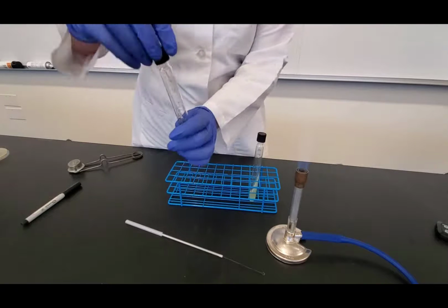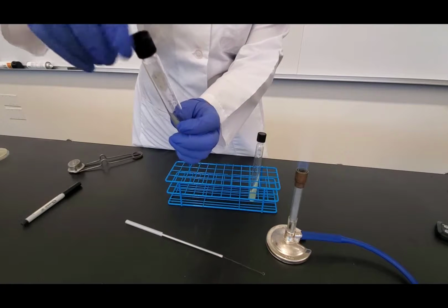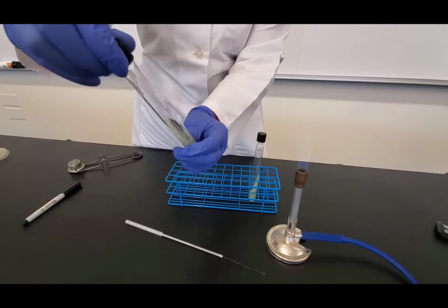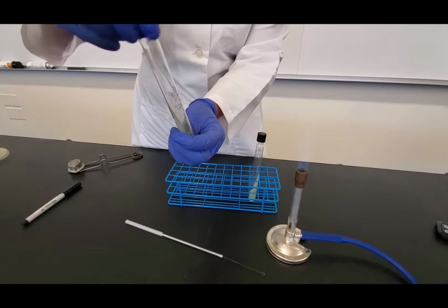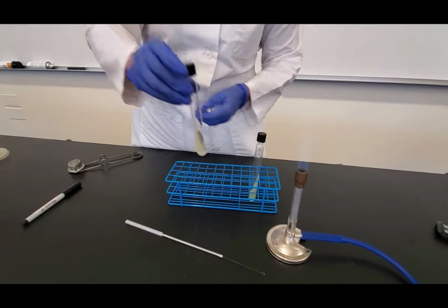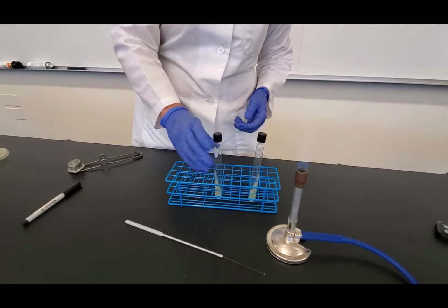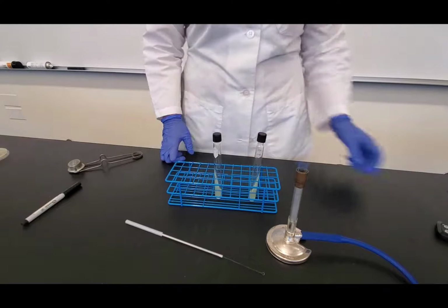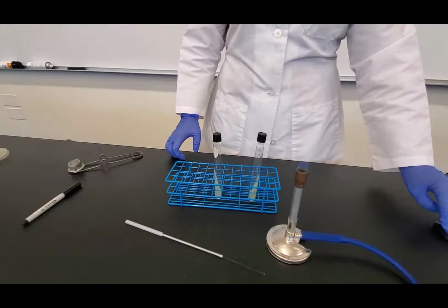Now, the other thing that I have to do is make sure that the cap is on properly before I put that in the incubator. And so what I do is I turn the cap all the way, I tighten it all the way, and then I give it about a half turn to unscrew it, and that makes the cap loose so air can still get in, but makes it so that the lid won't fall off. You must leave the cap loose when putting it in the incubator. And so now I'm ready to put it in the incubator.